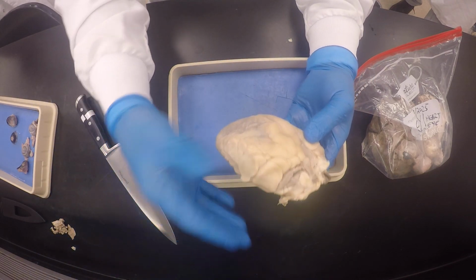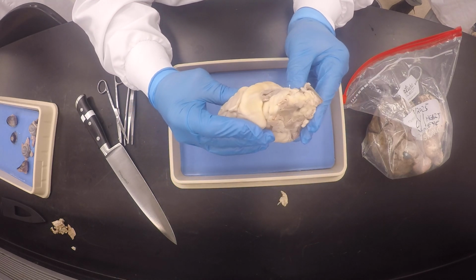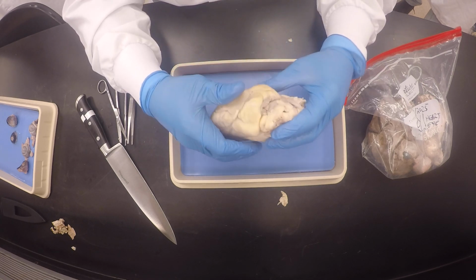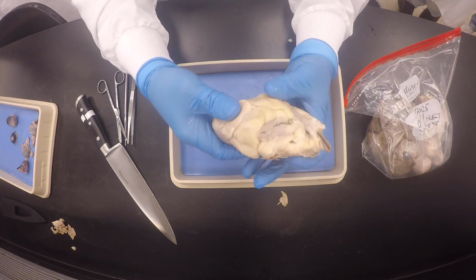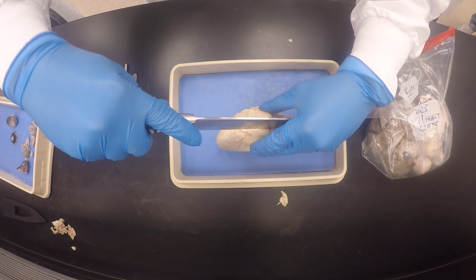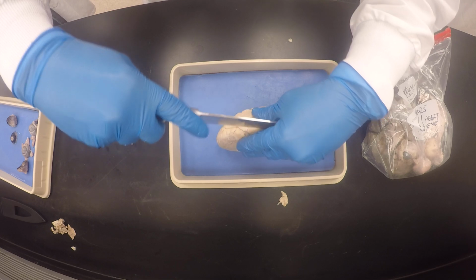So I'm cutting from here, going towards here, the small right ventricle, and I'm gonna use my aorta as a guiding light, so that I can, you know what I'm saying? So like this, you see what I'm saying? And then I'm gonna make my cut. So it looks like I'm kind of central.